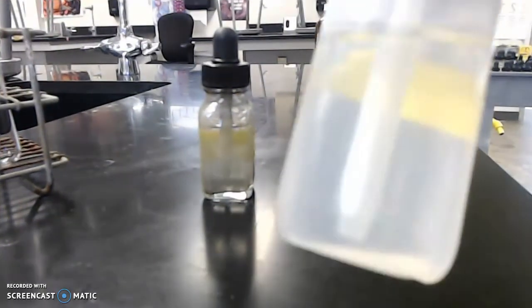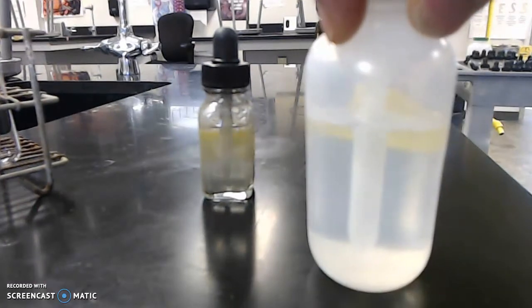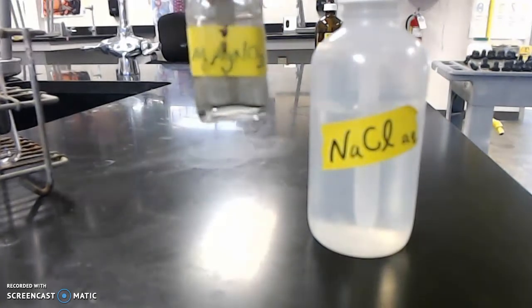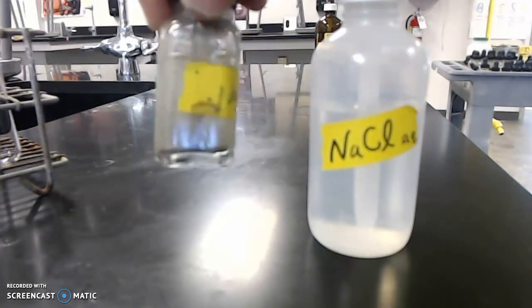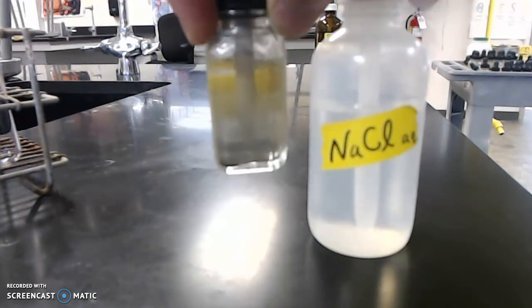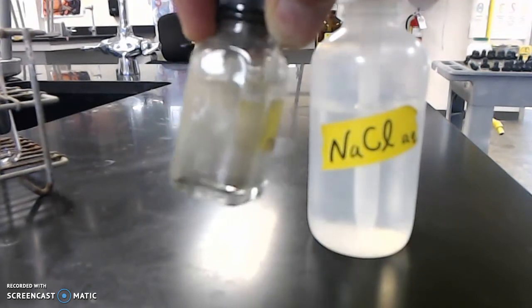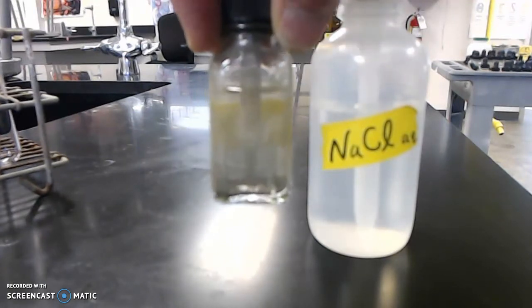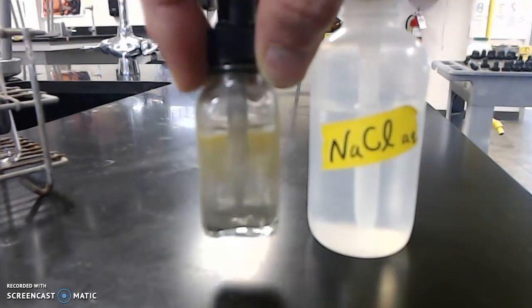Here's our sodium chloride. Wow, it looks like a clear liquid. And by the way, it's an aqueous solution. You see the AQ right there? AQ just means that there's salt dissolved in water. It's mostly water, and there is some salt that's dissolved in it. Same thing here with the silver nitrate. It's mostly water, and it has some solid silver nitrate dissolved in it. So there's another liquid. It looks fairly clear. It's got kind of a gray cast to it, and I think that's showing up fairly well on the video.